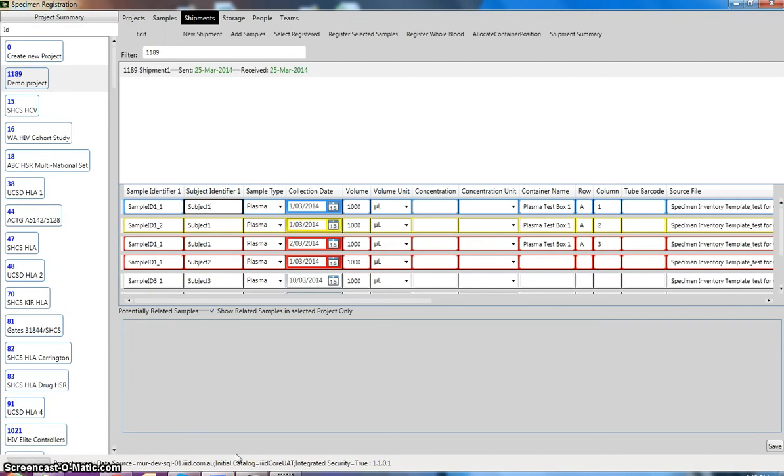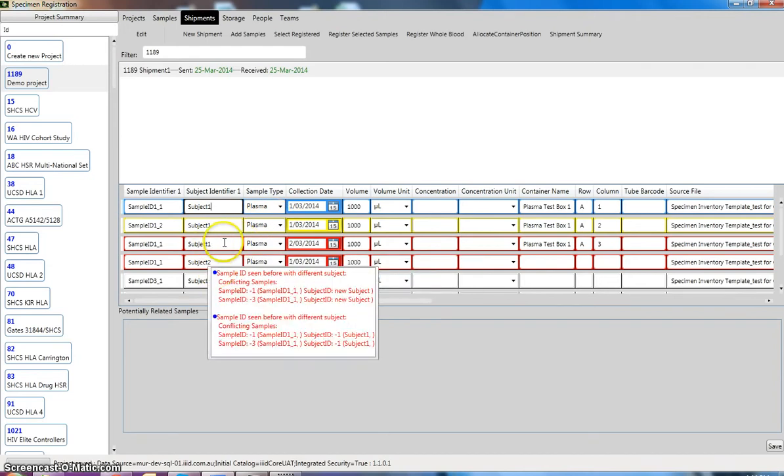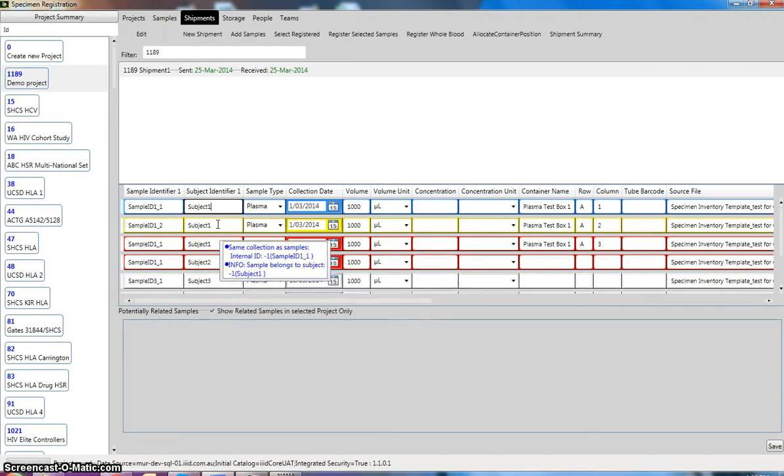I'm just going to carry on from Dan as he's added the samples to the shipment, and as you can see there's a color coding system here which validates the samples. So with the yellow color coding, it's more of a warning. As you can see, this sample has the same subject as the first sample in line 1, but the sample identifier is slightly different, but it also has the same collection, so it's just coming up to inform you of that.